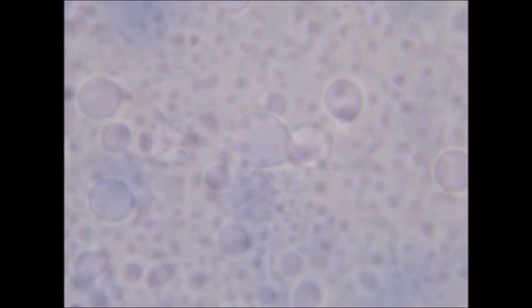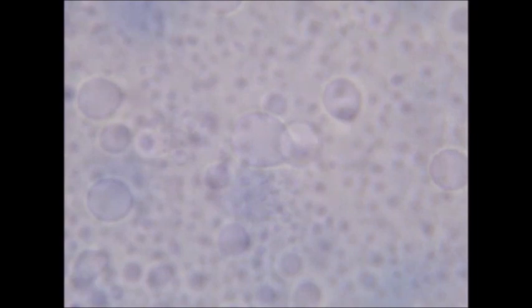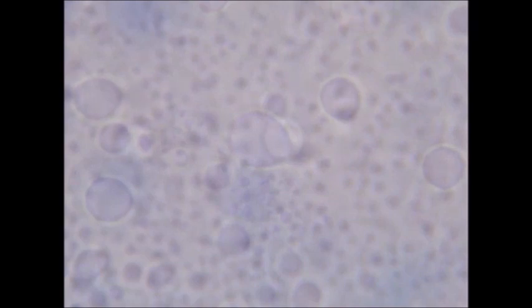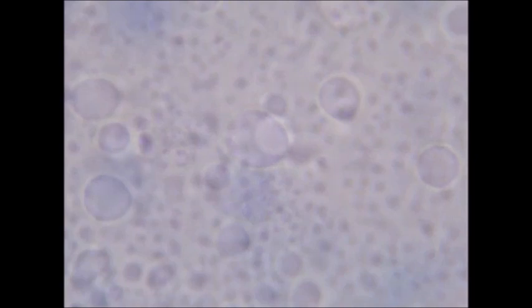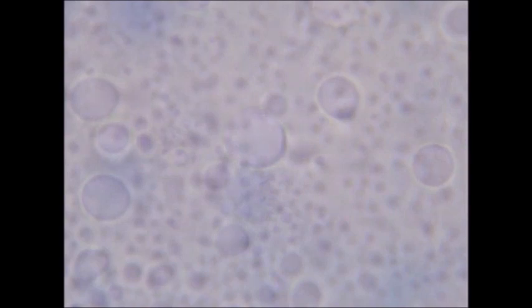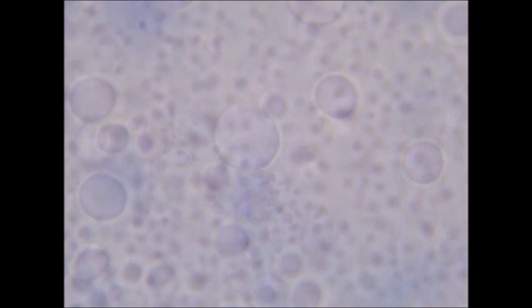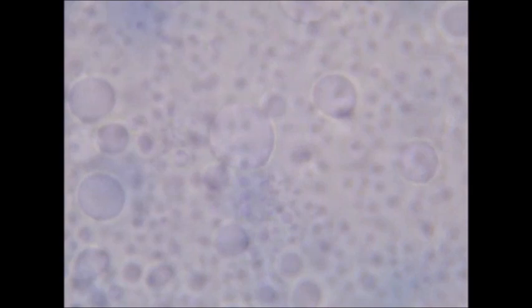I was hoping to capture spontaneous division of one of the vesicles. Unfortunately, most of what I've captured here is what I would call vesicle assimilation, where one vesicle swallows the other and becomes larger as a result. I would imagine that this is how these vesicles grew large enough, and then once they got so large, they simply divided by mechanical processes.